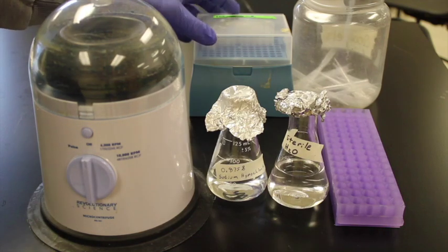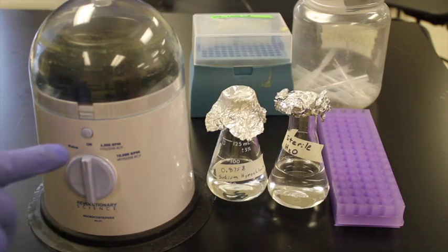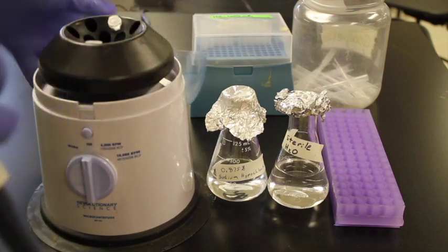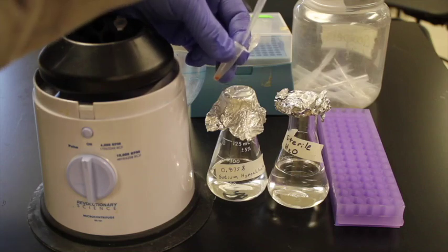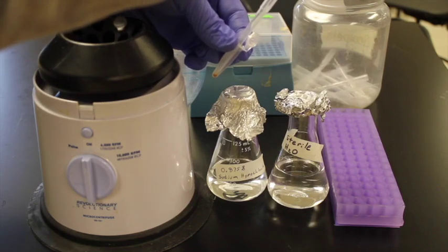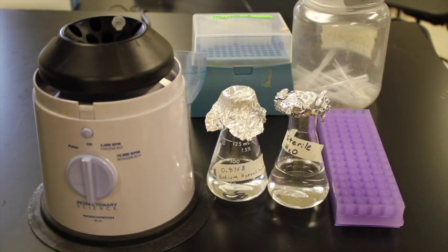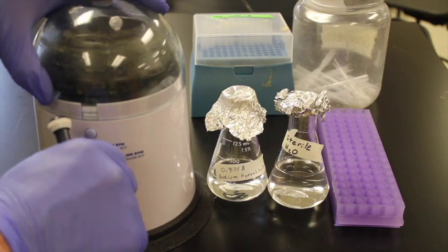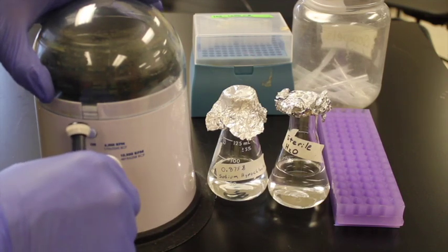Switch out pipette tips. Open it up. Then we'll carefully remove the water again. So I basically did that. So I'm going to redo it.